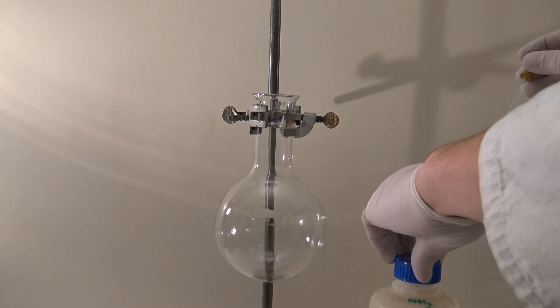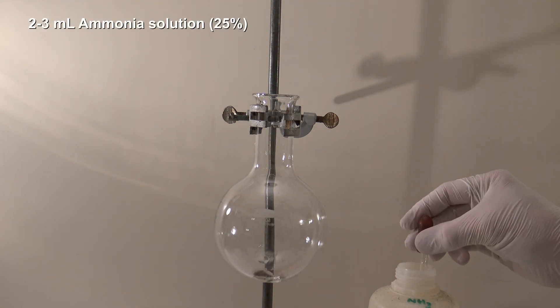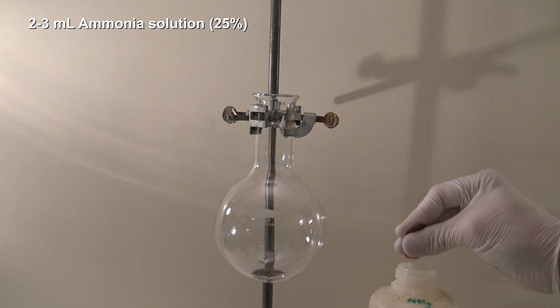For the experiment, some concentrated ammonia solution is added to a round bottom flask. 2-3 ml of a 25% ammonia solution are sufficient.